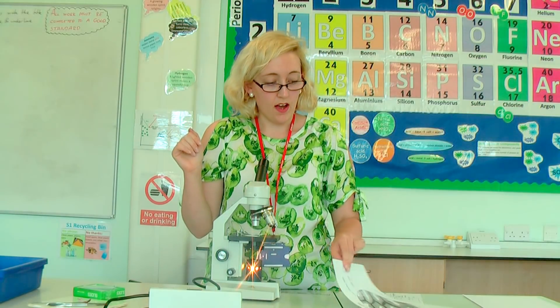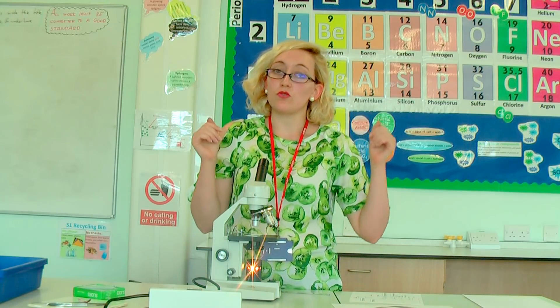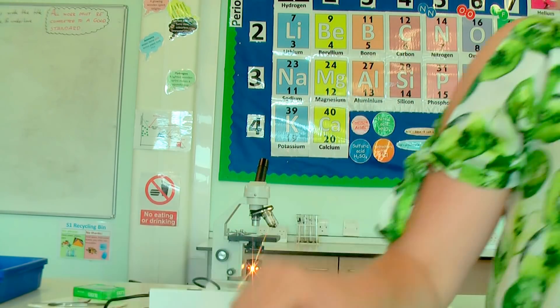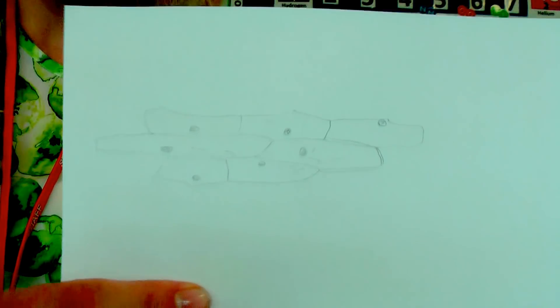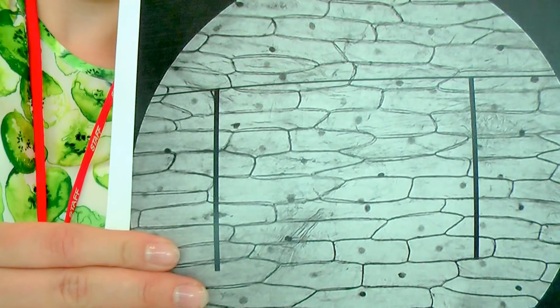It's up to you what magnification you want to go up to, but at some point you're going to have to start drawing. If this is my sample, what you want to do when you are drawing is just get the outlines of the cells. You do not have to draw all of them — just draw a few to get the general gist. I've just drawn the cell walls and the nuclei. You can see that's pretty close to the original — I've just done a few of the cells.